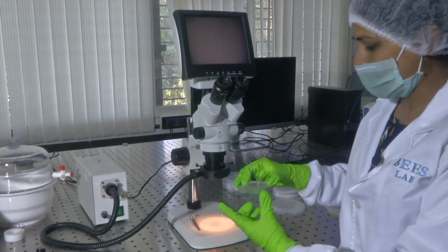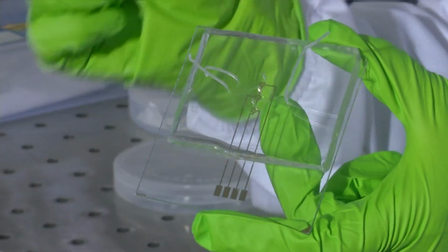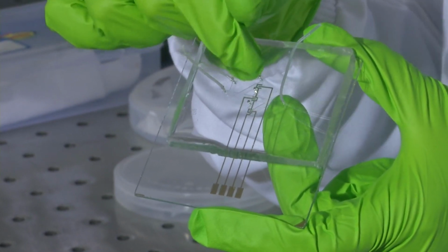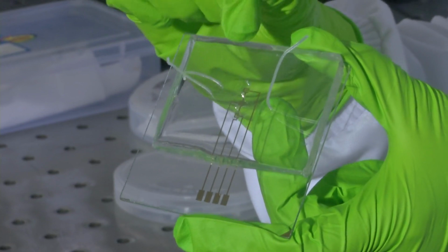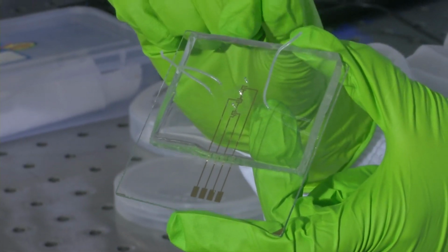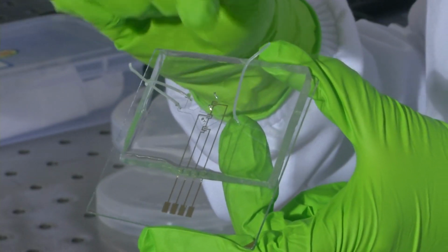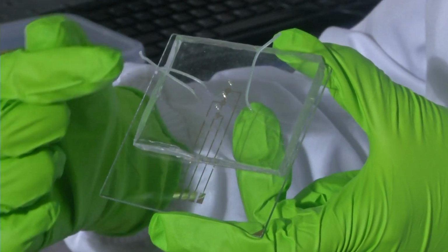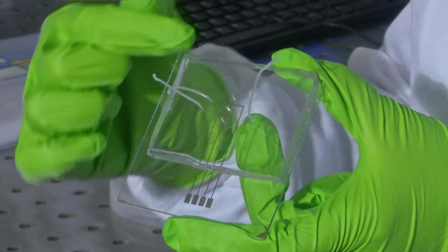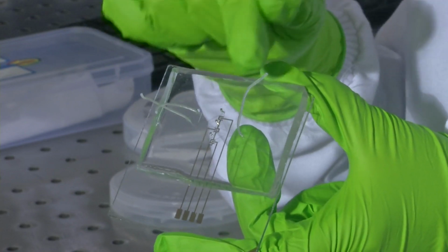Let me just show you the sample. So, this is the sample that I have. If you recall, there are these channels in a hexagon shape. We had used the same mold, the silicon wafer mold on which we had put PDMS, and the similar features were molded onto PDMS. I had already shown you these micro tubings through which you could flow. This could be an inlet and this could be the outlet tube through which you flow the fluid.